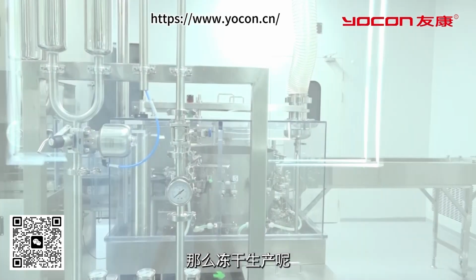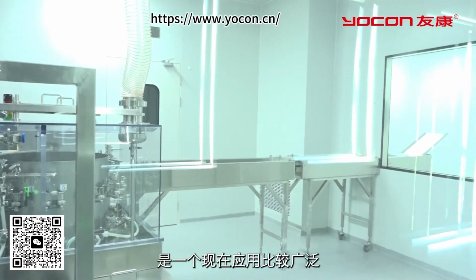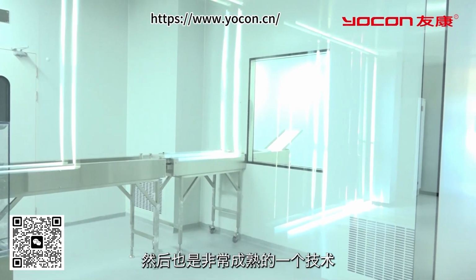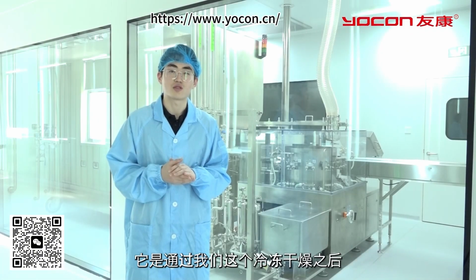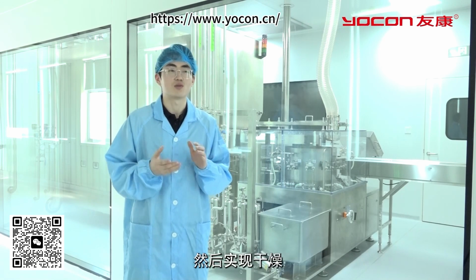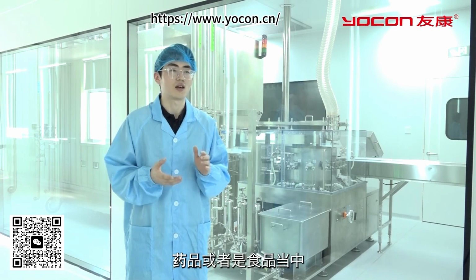behind me. Freeze-drying technology is now widely used and highly developed. It involves freezing the moisture in the product through a freeze-drying process and then removing the moisture by sublimation in a low-pressure environment, achieving freeze-drying. This technology is widely applied in preserving biological agents. The entire freeze-drying process consists of 5 parts.